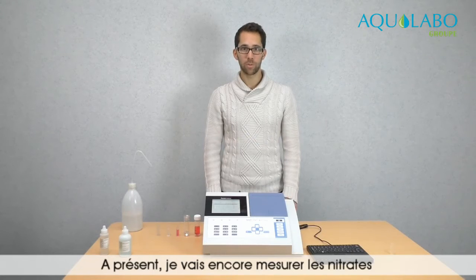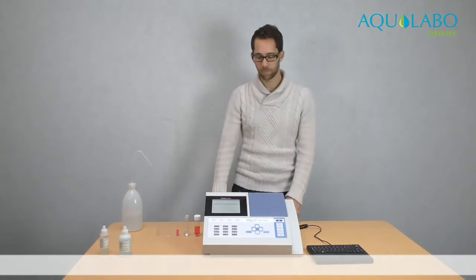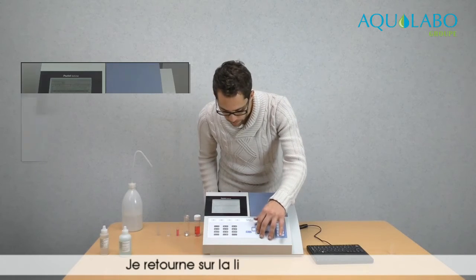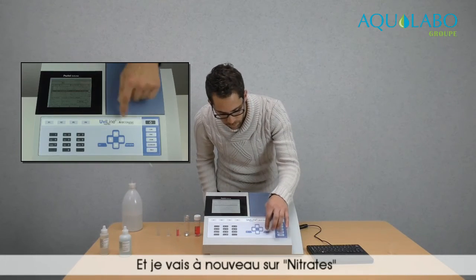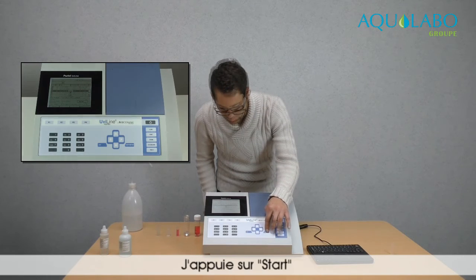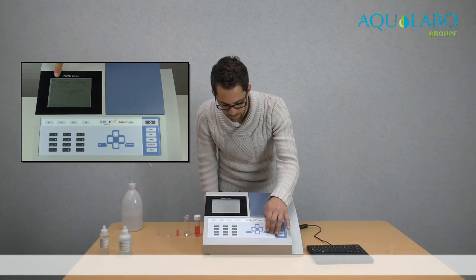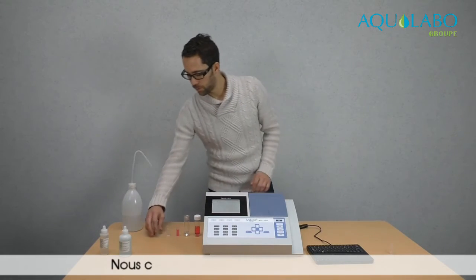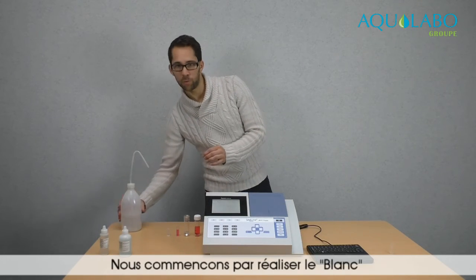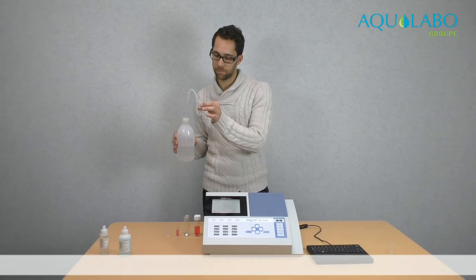Now I will measure nitrates again, but without reagents thanks to the UV method. So I go back on the list of the method and I go to nitrate again, and I press start, and this time I choose spectralize. So first we have to make the blank with demineralized water.